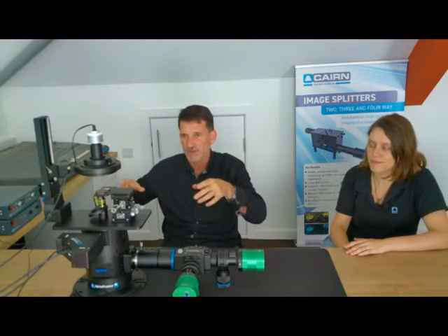So in this video, we're going to introduce you to the openFrame sustainable microscope concept, which was conceived by Professor Paul French at Imperial College London, co-developed and supported by us at Cairn Research. So what is the openFrame? The openFrame is a stable, sustainable and affordable platform that enables us or other companies or labs to build highly optimized application-based microscope solutions. Everything is centered around the objective lens and full optimization of the infinity space.